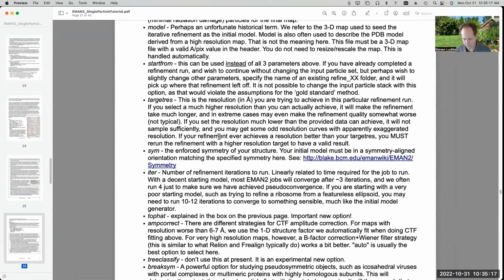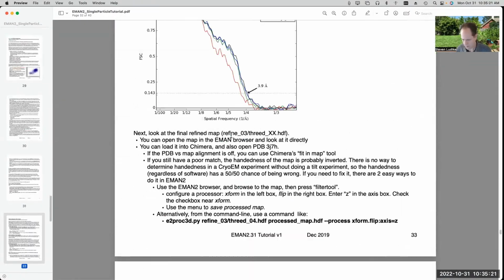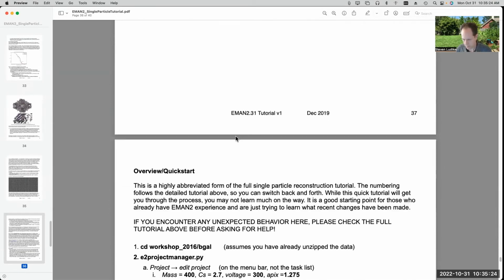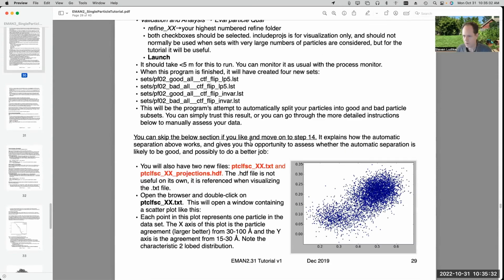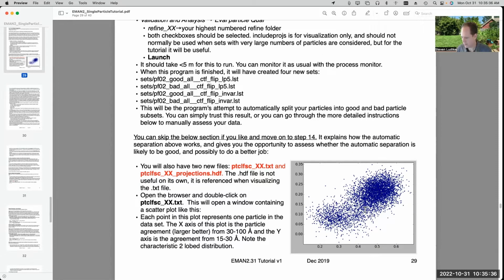If we look at the tutorial again, after running the refinement, it talks about, where is it? Sorry, I skipped over it. Here we go. Identifying bad particles in the data set. I used the deep learning particle picker when I did the particle picking for this. If you use the predefined particles, you get about 5,000 particles, and a pretty good chunk of those are actually ice contamination in the data set that was provided when they published the paper. When you use the deep learning picker, it does a much better job of getting rid of those ice contamination particles. So I got about 10,000 particles, and only maybe 500 to 1,000 of them are bad in some way, probably actually even fewer than that.